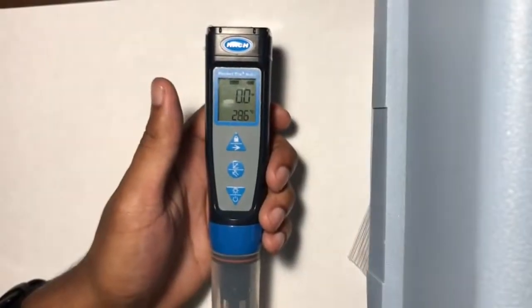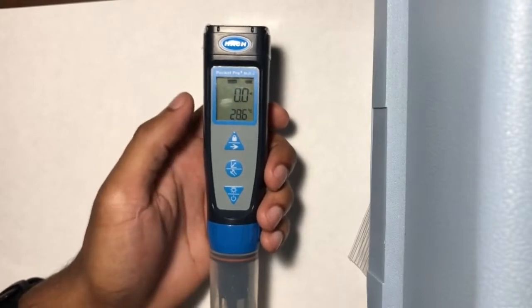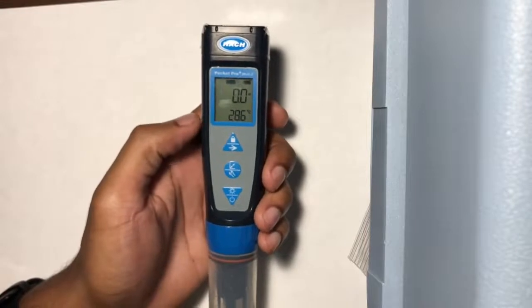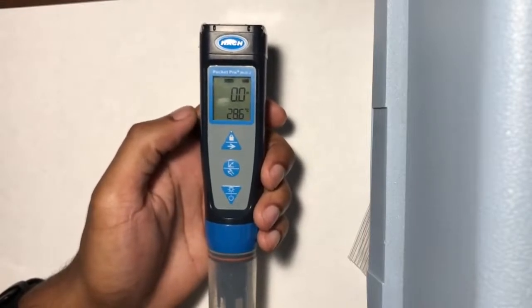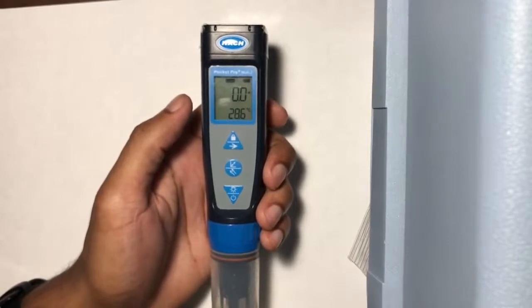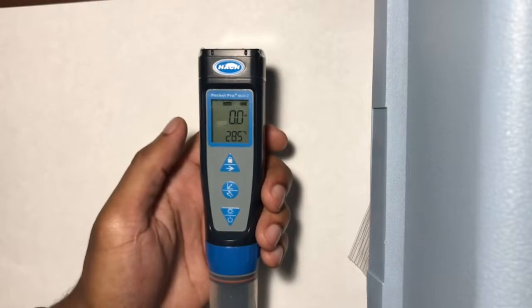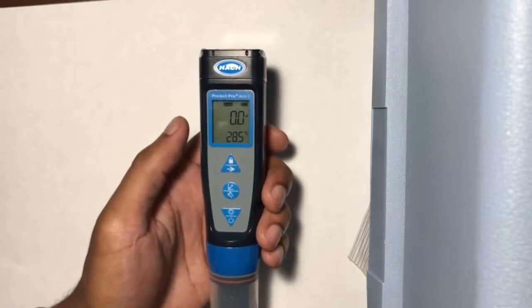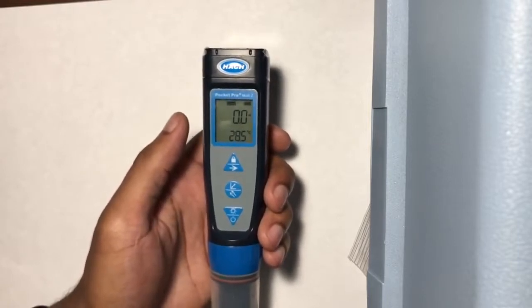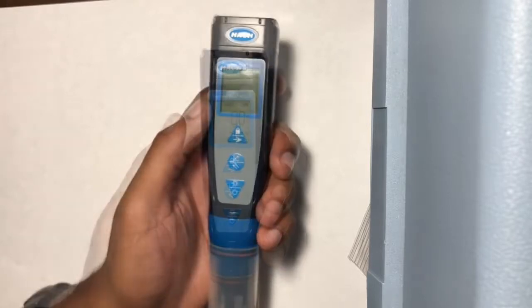If you successfully reset the Hach and one of these problems persists, the machine reads SENSOR, the machine reads ECAL, or you get 4 dashes on the temperature row, which is the bottom row, call your water quality monitoring coordinator. There's a problem with your meter and you're going to have to come and get a new one. If you see 4 dashes on the top row, attempt a dilution. Remember to indicate on your datasheet if you tried a dilution. If it persists, call your water quality monitoring coordinator.